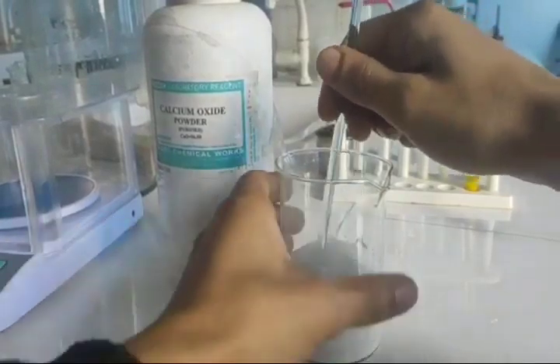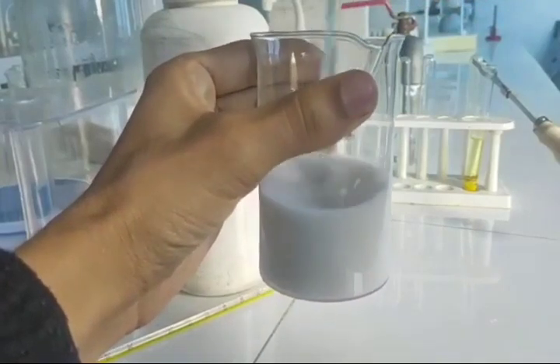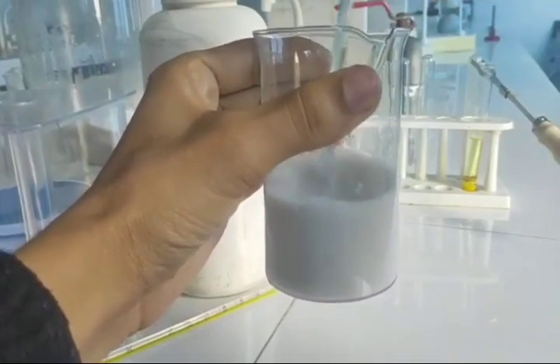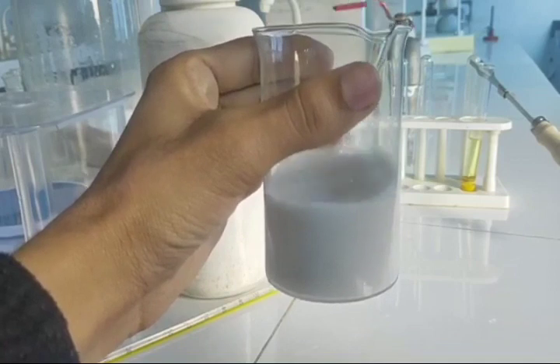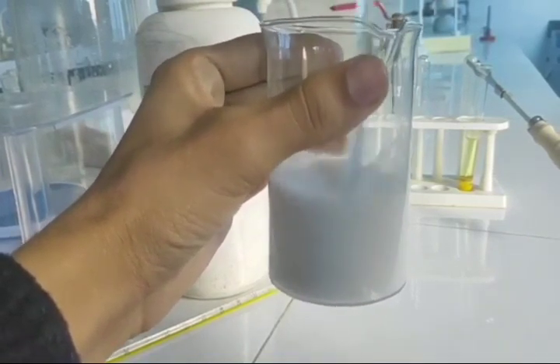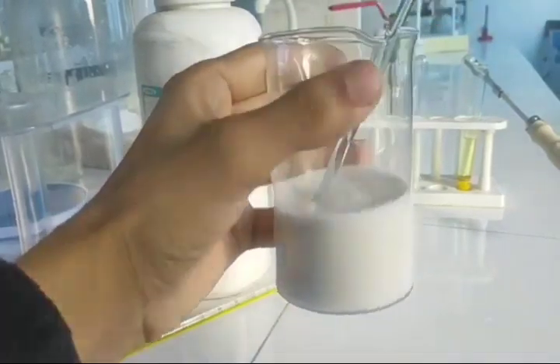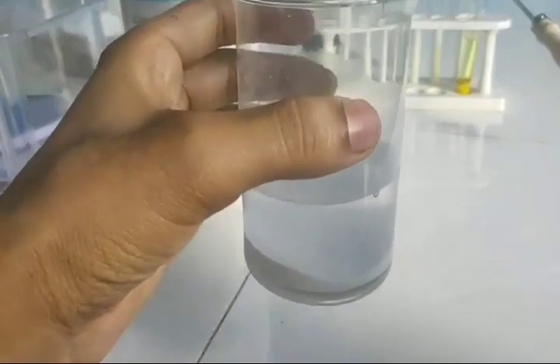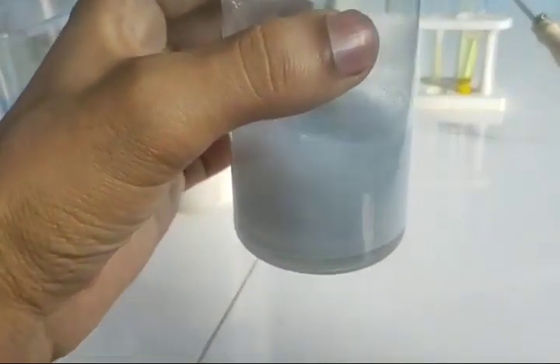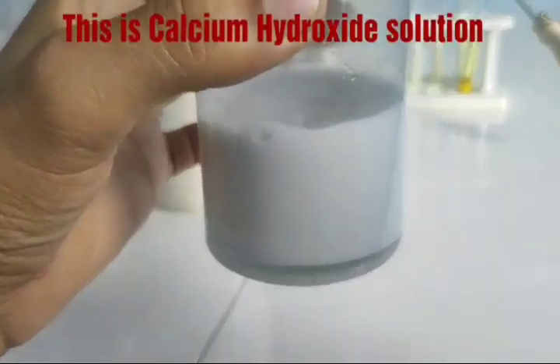By stirring, it will slowly dissolve. It takes time to dissolve, but it never dissolves completely; it slowly settles at the bottom.